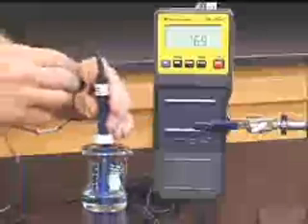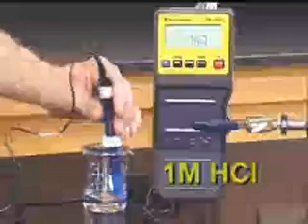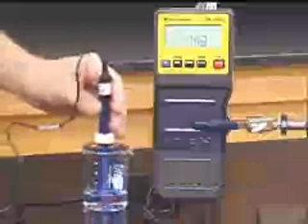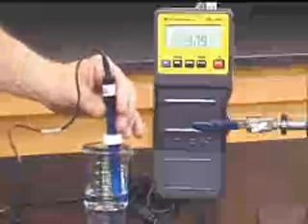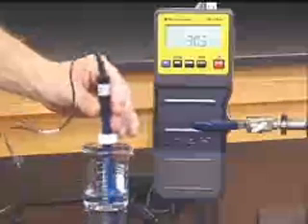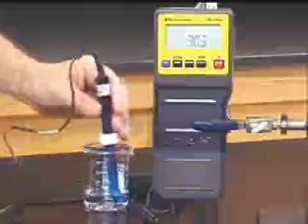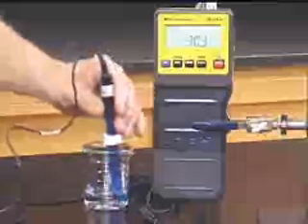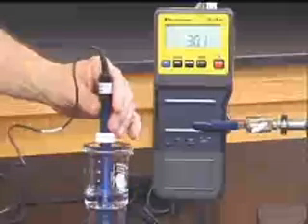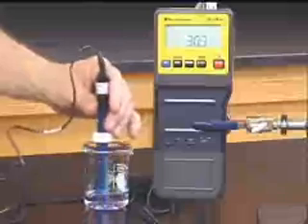We're going to add a drop of one molar HCl. Notice that the pH drops rapidly. Pure water is not a buffer. If we add a strong acid to it, the strong acid ionizes 100 percent. If there's no buffering capacity in the water, the pH drops rapidly.